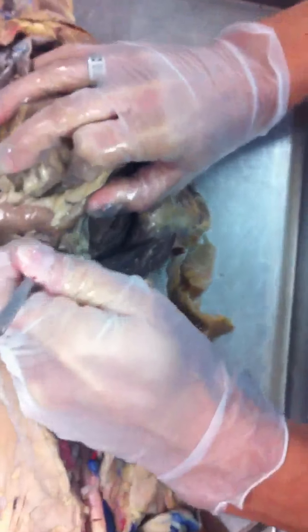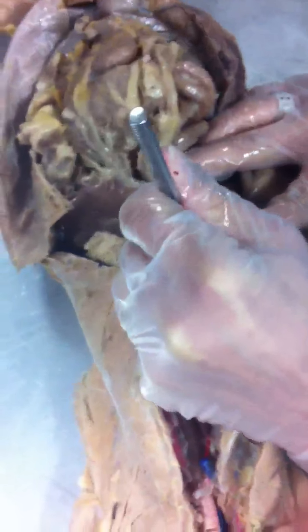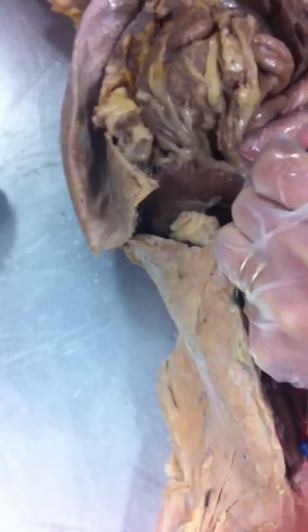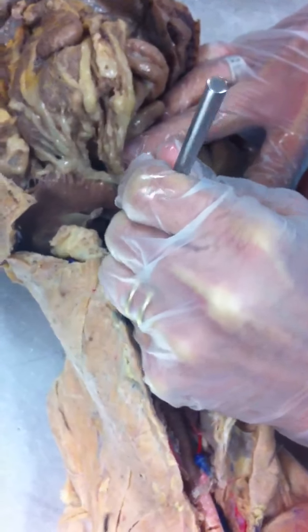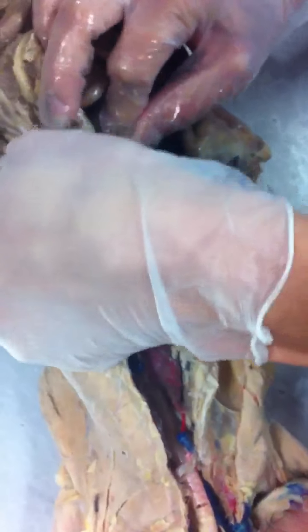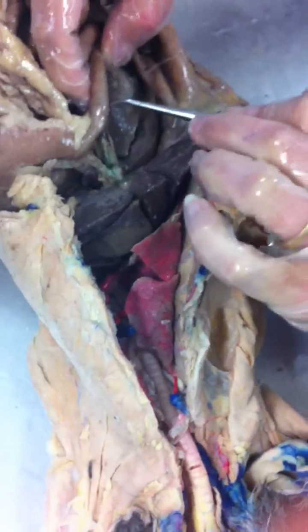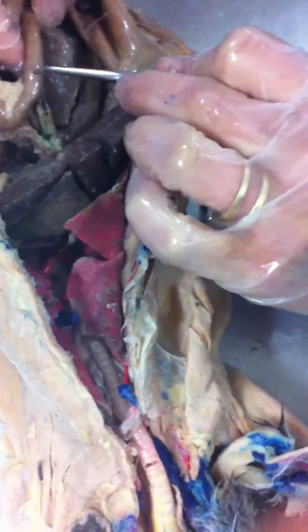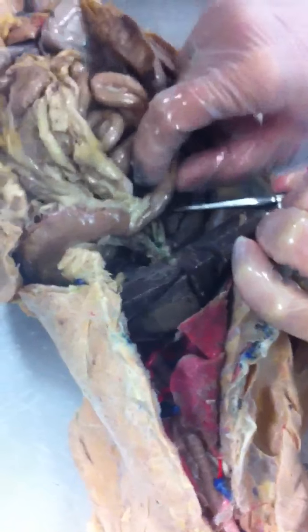What's the green sac sandwiched in the liver here? Gallbladder. Remember, there were 3 ducts that this group did not isolate, so we can't really see them very well. There should have been a duct that comes out of the gallbladder here, the cystic duct, and the ducts that come out of the liver, hepatic, and where they come together, the common bile duct. The common bile duct dumps into the duodenum. What's the purpose of bile again? Breaks down fats.